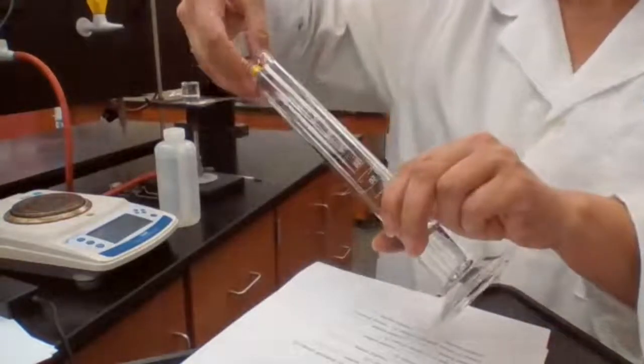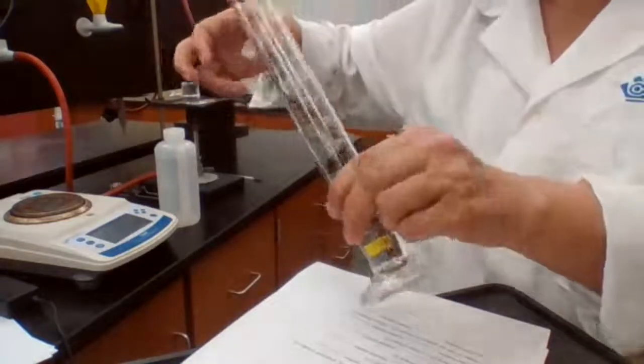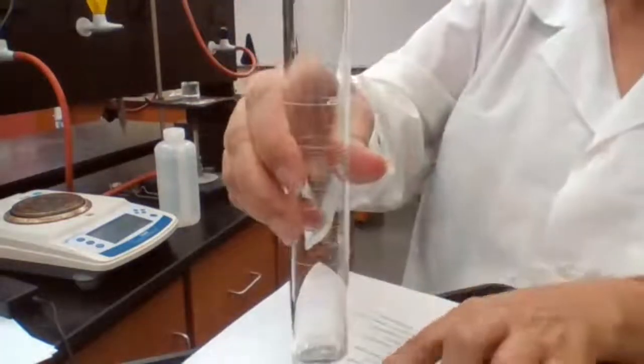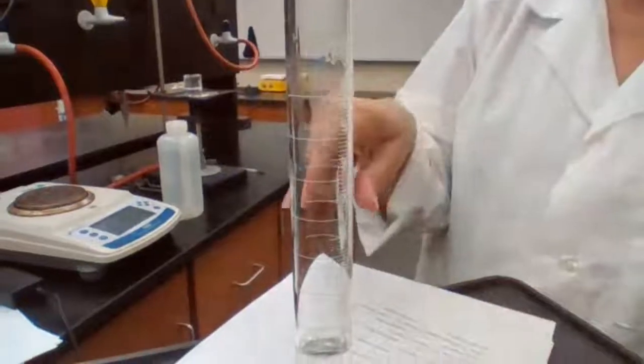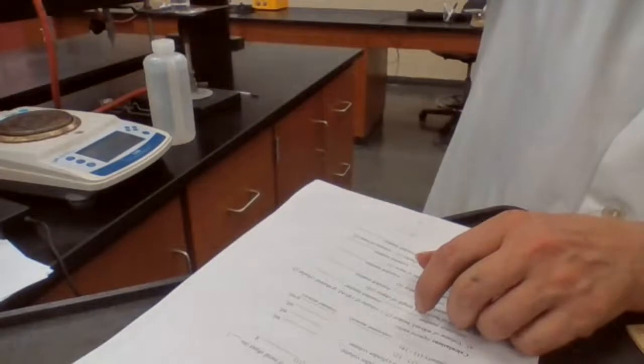You cannot measure the dimensions and then get the volume by formula. If the liquid doesn't react with or dissolve the sample, then you can use this method. The solid must be more dense than the liquid, otherwise it will float rather than sink.